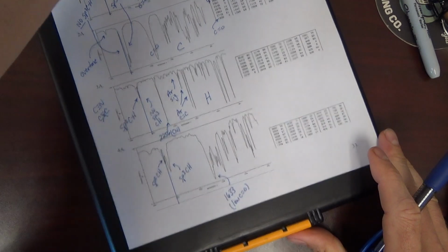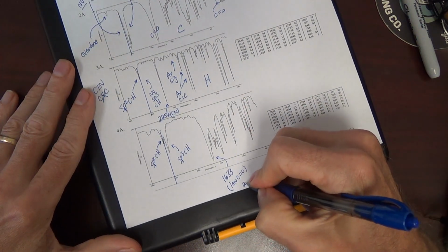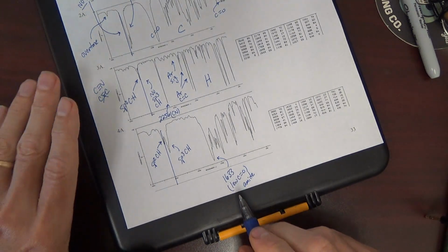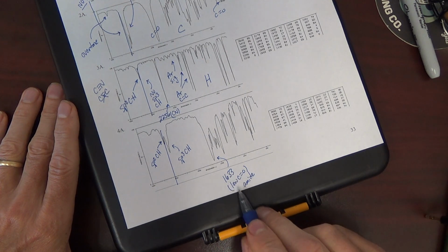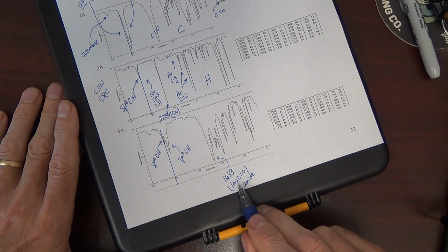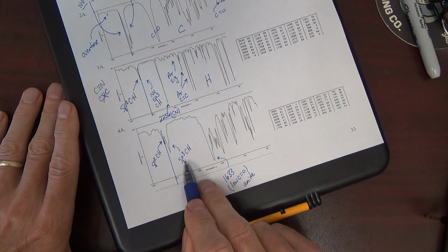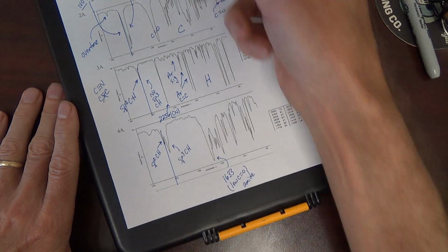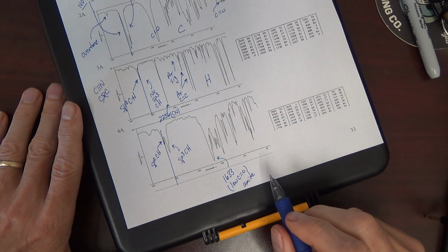What does that tell us? What type of functional group would have a low carbonyl? Most likely amide, okay? Especially that low. Something in the 1660, 70, 80 range may not be an amide. Looks like an amide with both types of hydrogens, sp2 and sp3 CH. None of these examples had an sp CH, which would be about 3300.